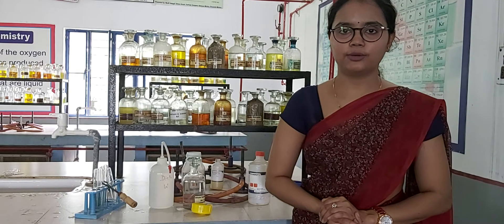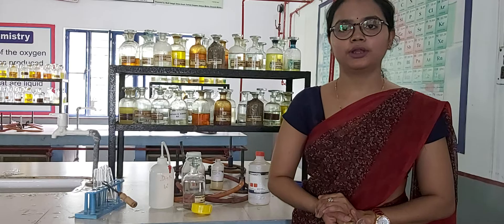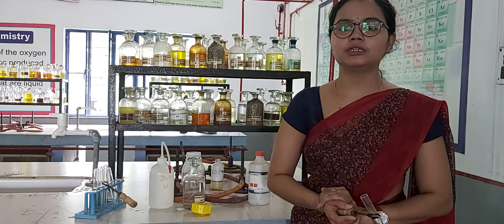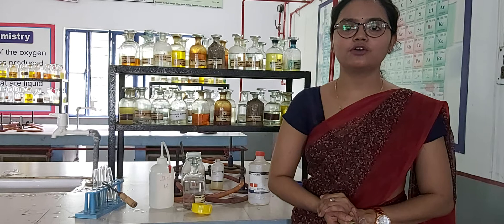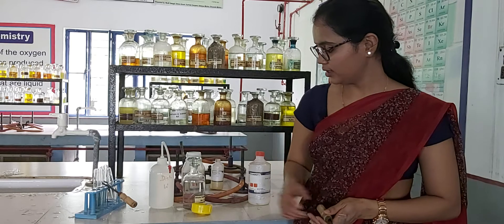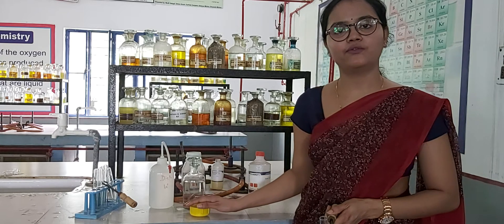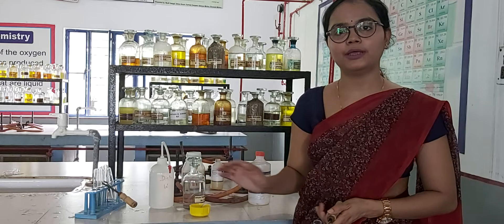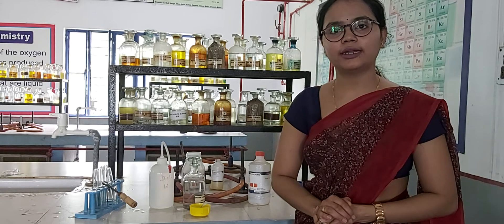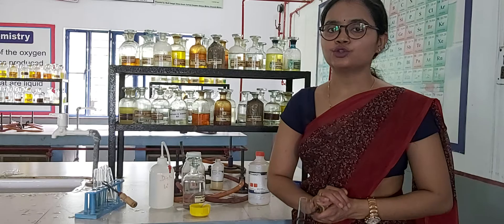Hello dear students, a very good morning to all of you. Today we are going to do our first practical which is detection of acidic and basic radicals. Here we have our given mixture, and in this mixture we have to identify the basic and acidic radicals. First we will detect the basic radical.